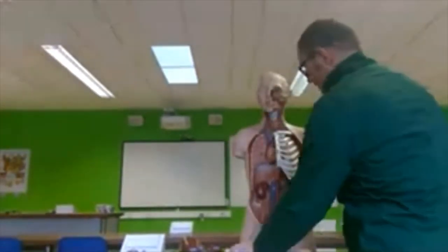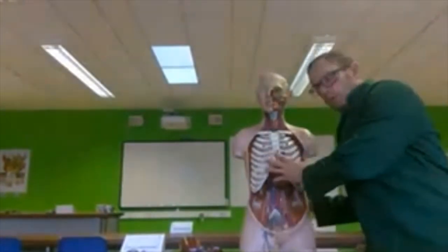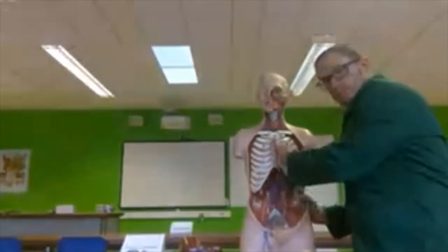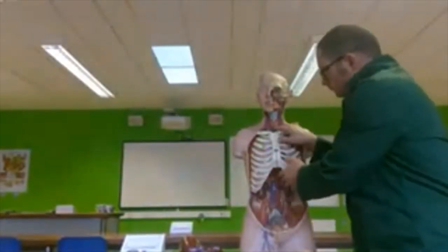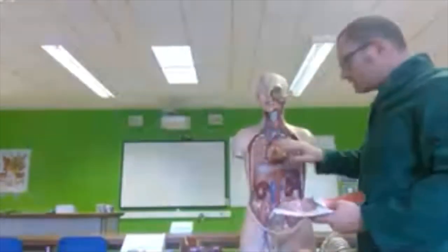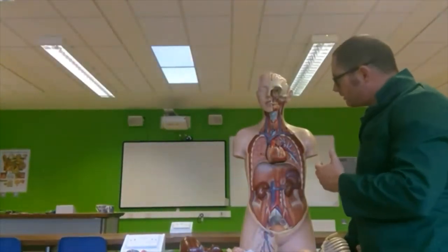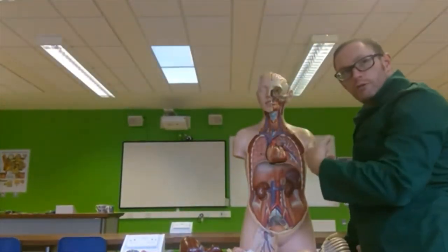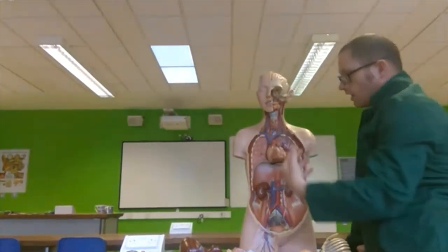Looking down onto the rat, we can see the rib cage protecting the lungs and the heart beneath. What I'm going to do is take some scissors and cut up through the sternum, which will separate the rib cage. I'll cut through here, essentially doing what the model does, which is to allow the rib cage to come off. In the dissection, the lungs should remain in place, held with pleural membranes which lubricate the lungs against the rib cage. I'll then try to take the heart and lungs out in one go by using the trachea — a tough fibrous pipe that links to the lungs.